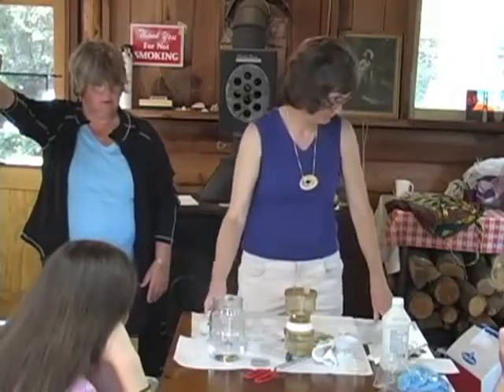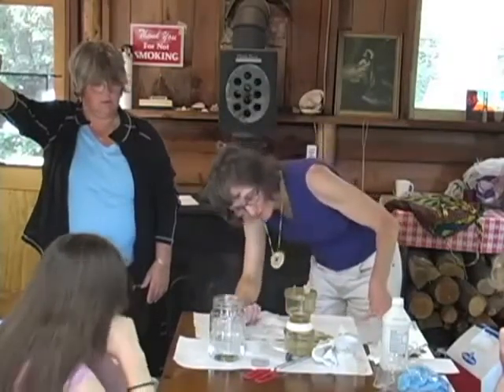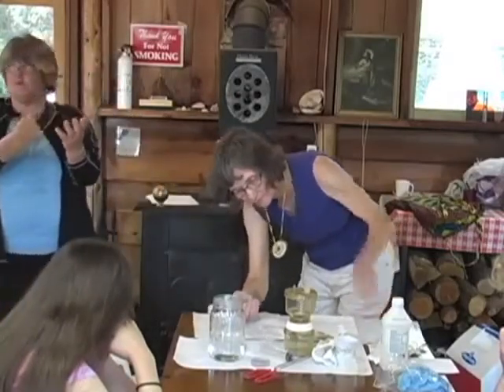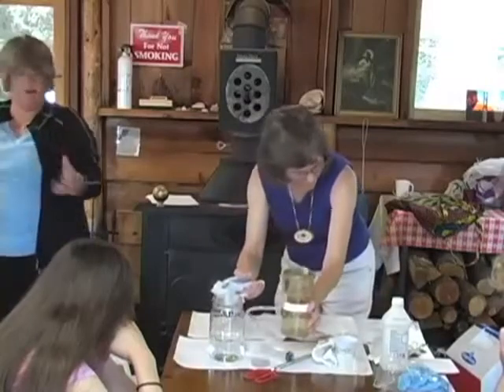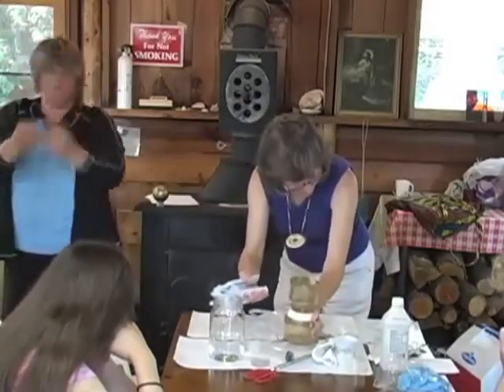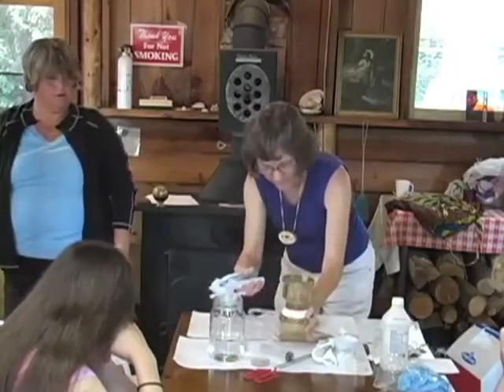Use the suction pump to draw all the sample through the filter paper. This pistol grip is literally, every time she squeezes, it's sucking air out of the bottom chamber. That brings the water through. Swirl the water while pulling it through the filter unit screen to reduce the amount of bacteria adhering to the filtration unit walls.